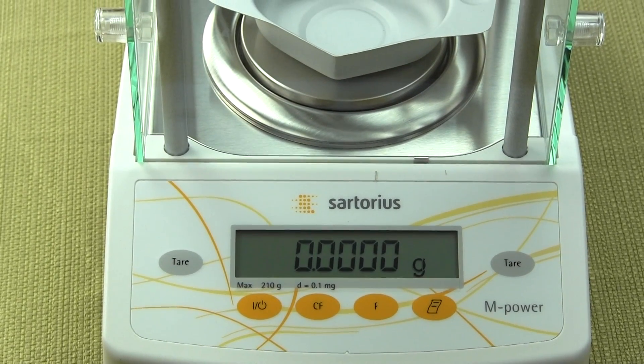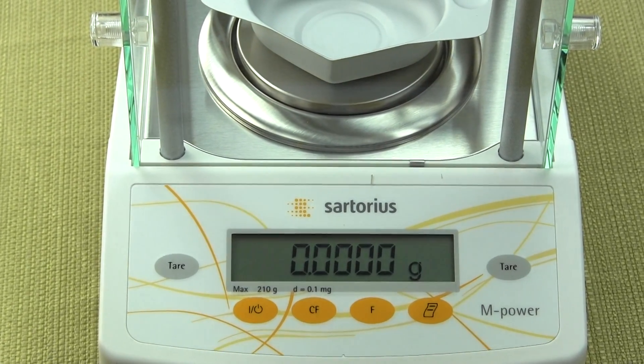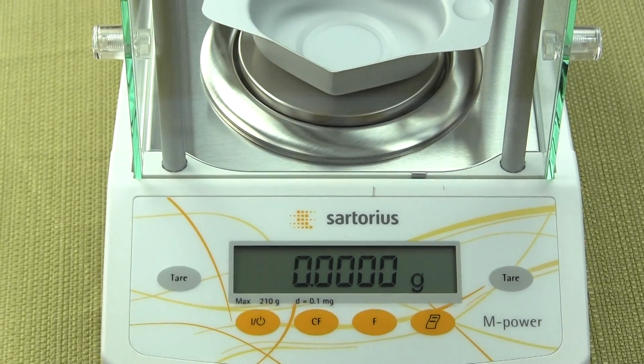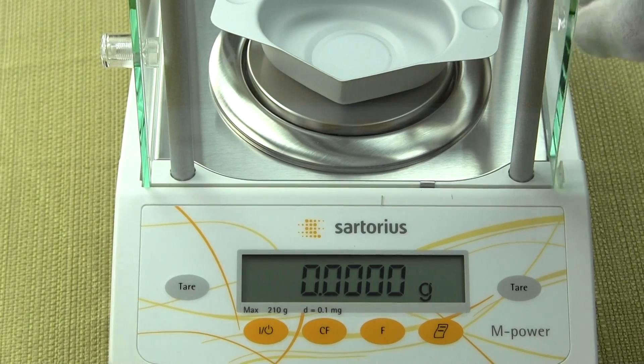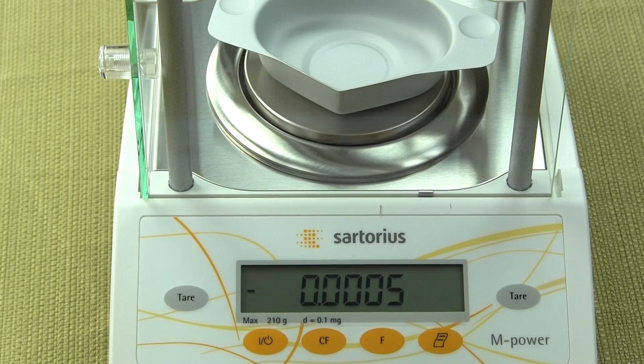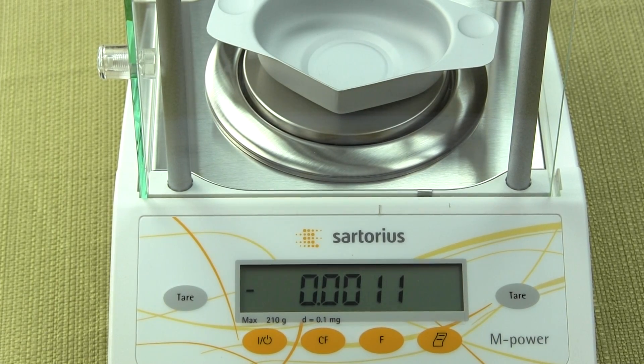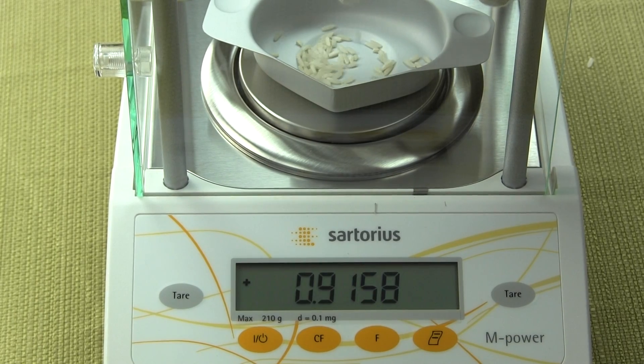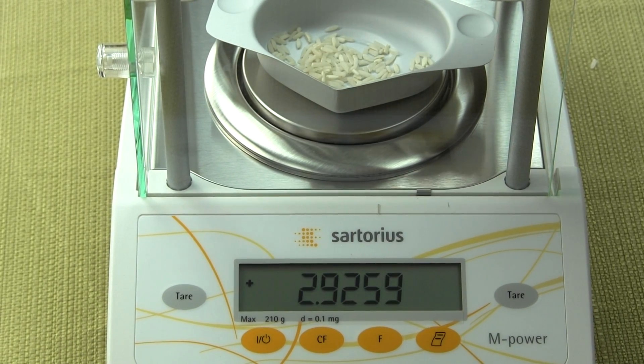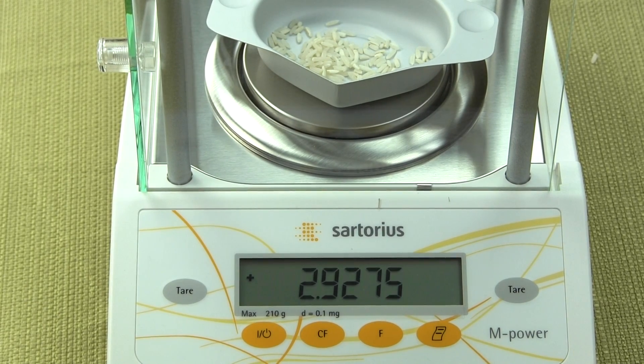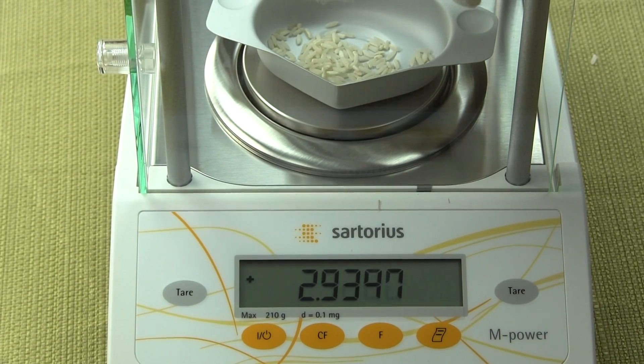If I wanted to weigh something, we'll say I wanted to weigh some rice here and I'm going to put some rice on. Well, this pan's too big, but I'll just sprinkle it on. If I wanted to weigh some rice, you can get an idea of the response time of the balance.